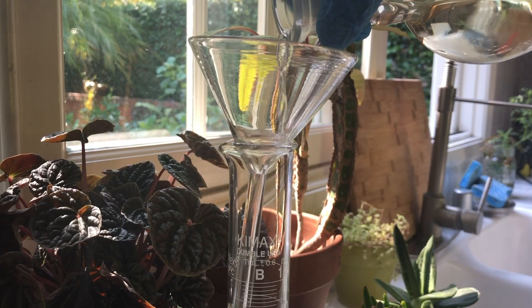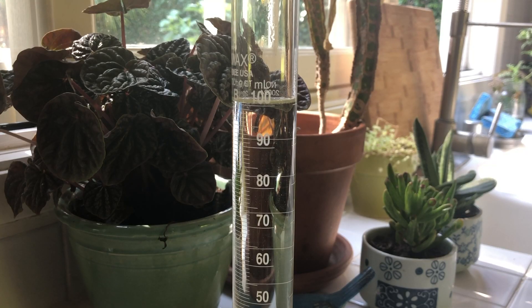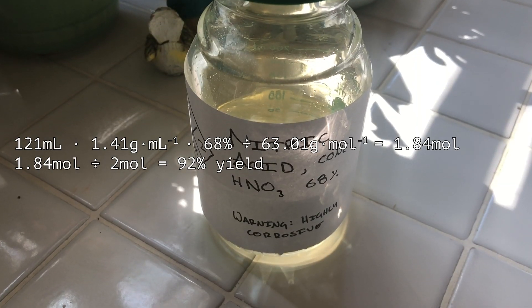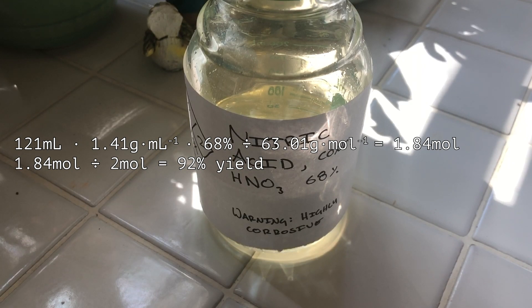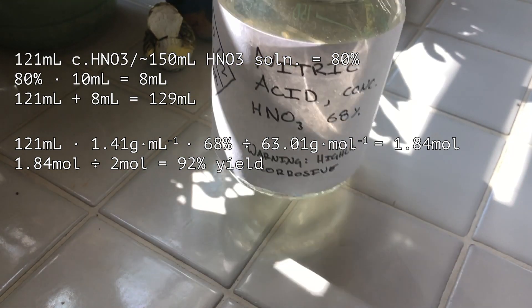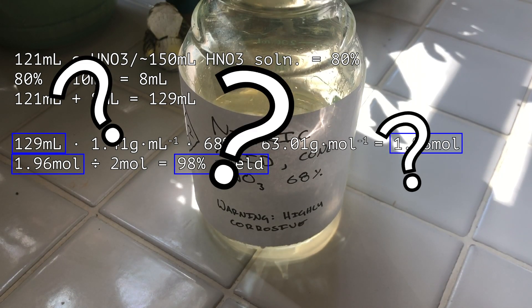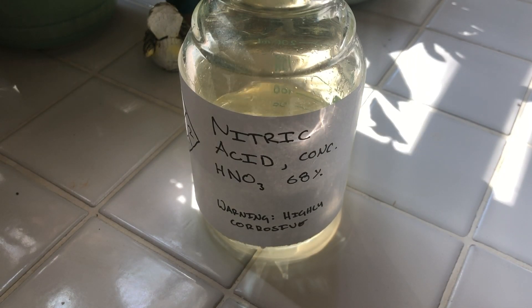The concentrated nitric acid was measured to be 121 mls and was stored in a proper container and labeled accordingly. The 121 mls represents a yield of 92%. I did use about 10-20 mls dissolving that penny, so this would bring the yield up to probably about 95%, but it's hard to say. Still though, this is a pretty good yield.